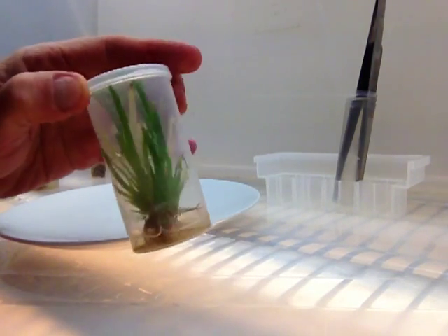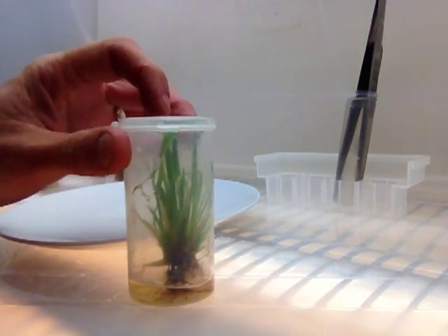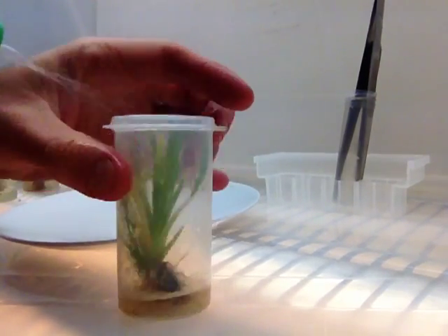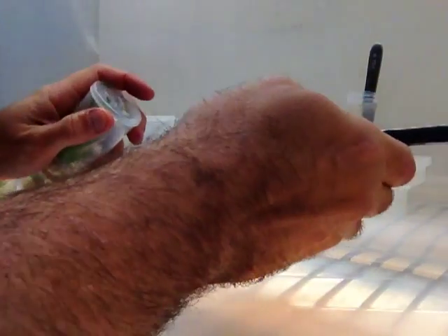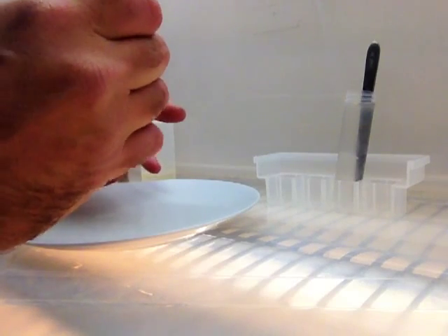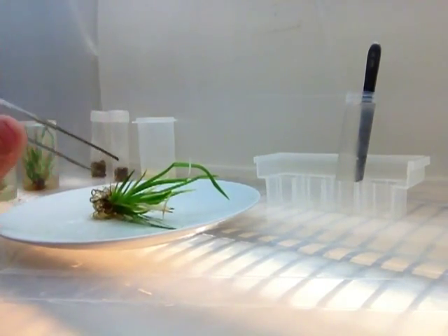Here's one of our famous yellow iris. It's really one of the easiest plants to grow in tissue culture, so we use it for teaching. Spray the neck of the bottle — hopefully you can still see around my hand. Open the bottle, pull out the plant, put that away.